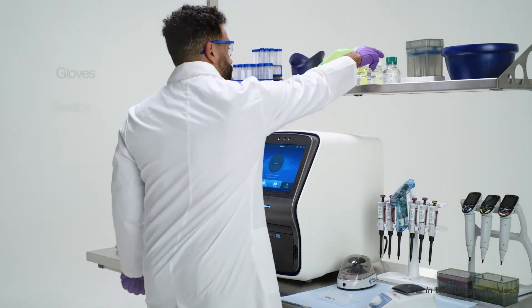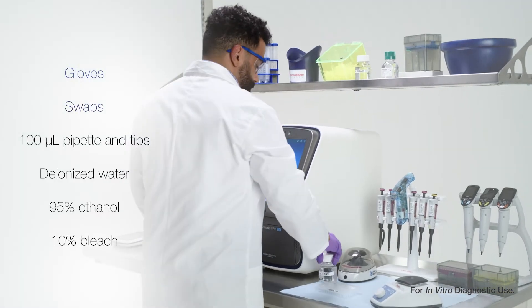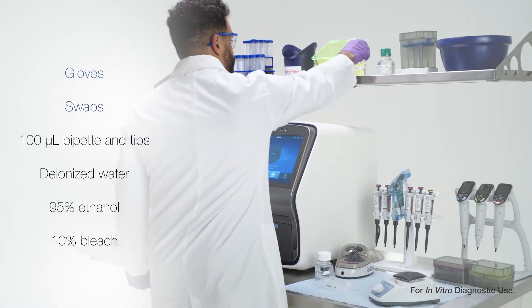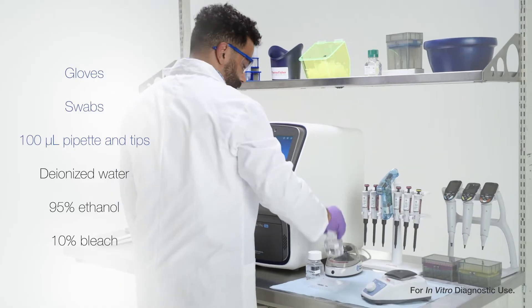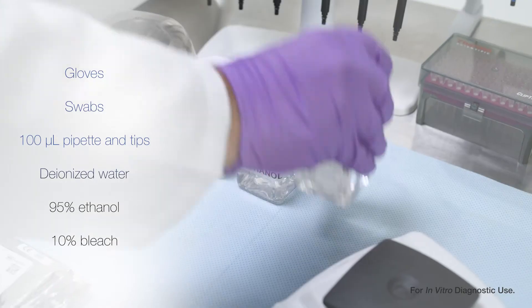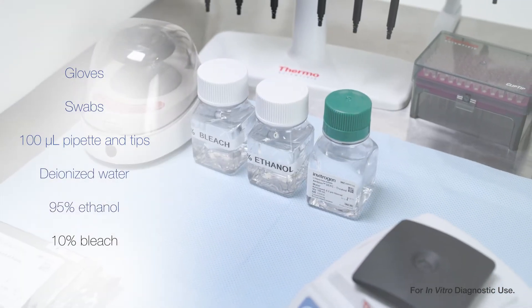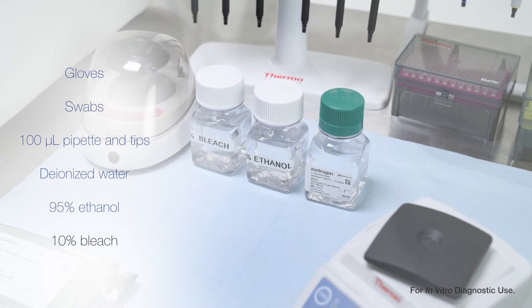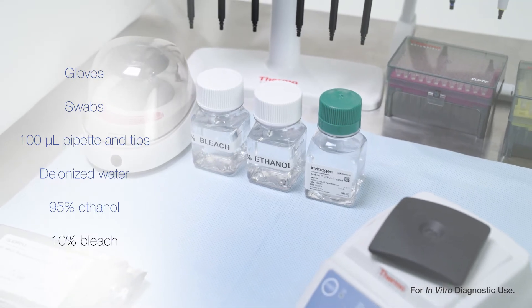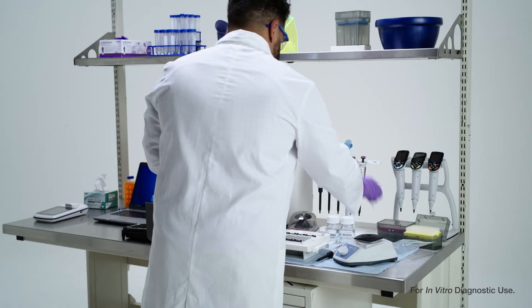Before you start, you'll need gloves, lint-free or nylon swabs, a 100 microliter pipette and tips, deionized water, 95% ethanol, and for difficult to clean wells, 10% bleach.